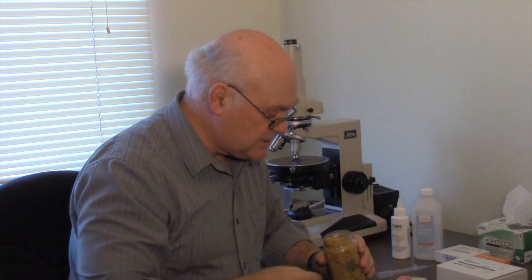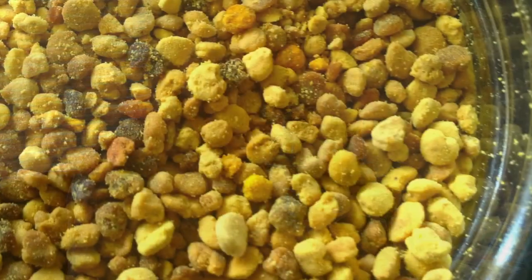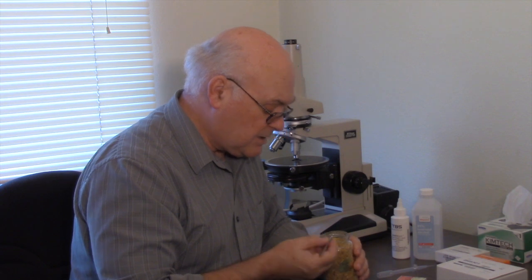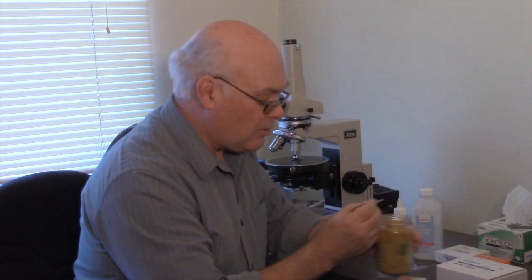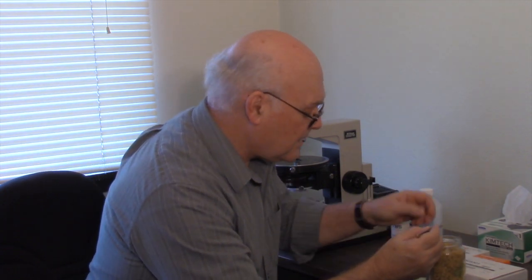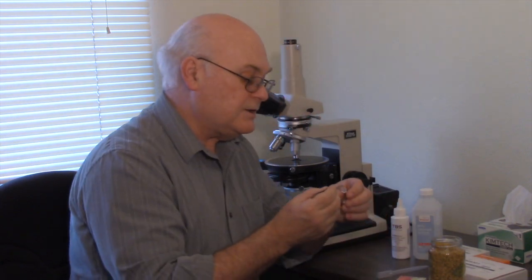There are a variety of colors here, so we'll just pick one. Let's pick a nice yellow colored one and put that into the vial.